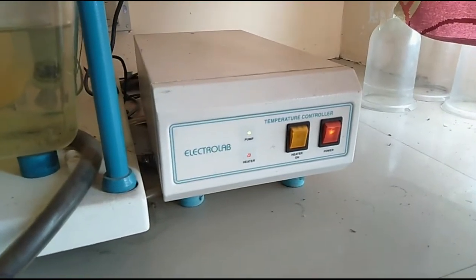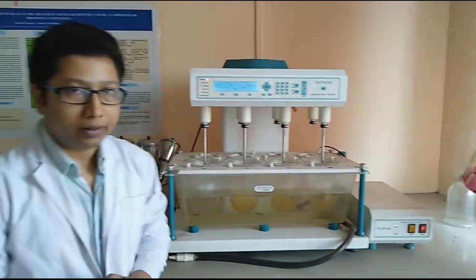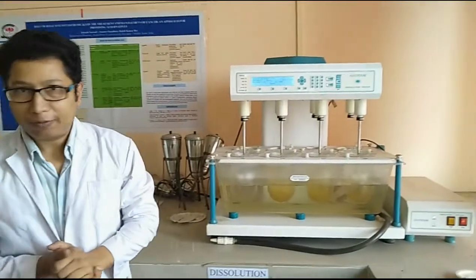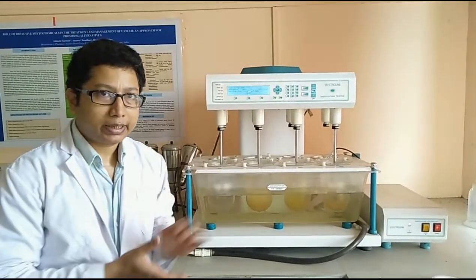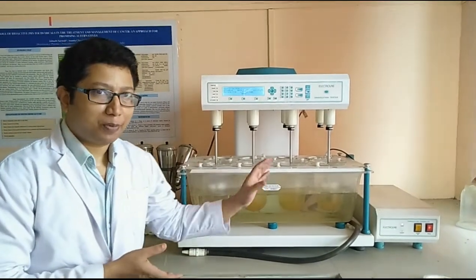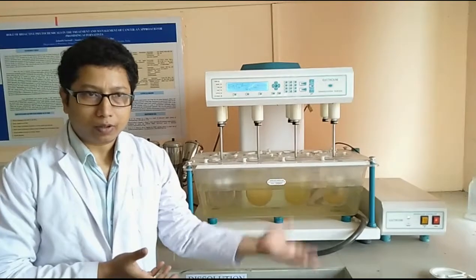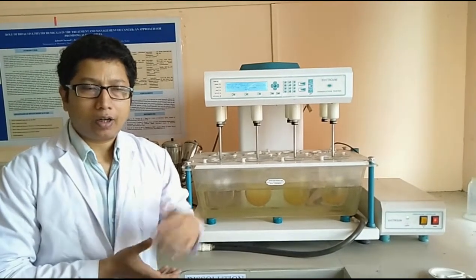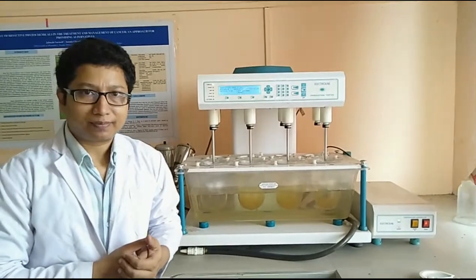This is the particular heater system we have utilized for overcoming these issues. So I hope I was able to give you a brief on this dissolution system. Friends, we are just going to follow a similar process for each and every dissolution of different sorts of tablets or capsule formulations, using the same protocol.